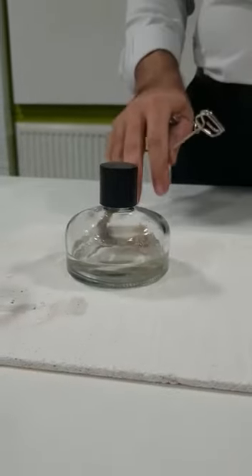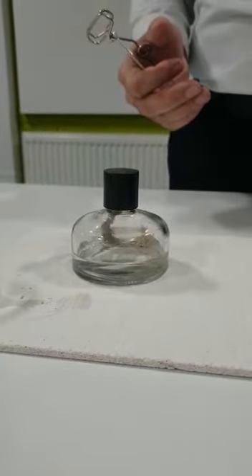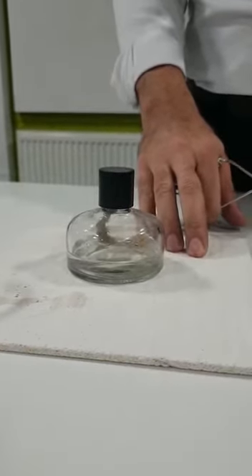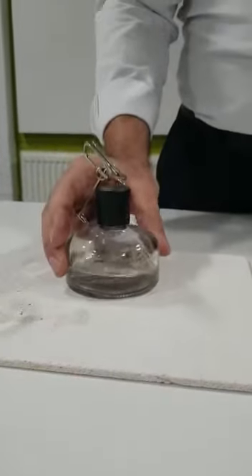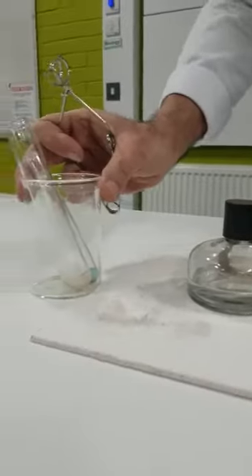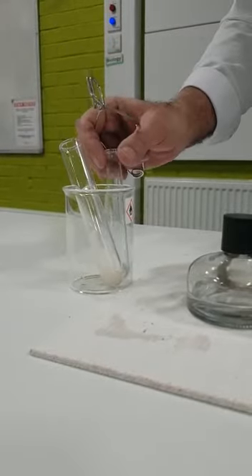Alright, so this is an experiment to see what is the difference between chemical changes and physical changes. Each group will be given a heat-proof mat, a burner with alcohol in it, because here we don't have gas, we can't use a Bunsen burner, we use this instead. And we'll be given two test tubes in a beaker. One is ice and one is a powder of copper carbonate.